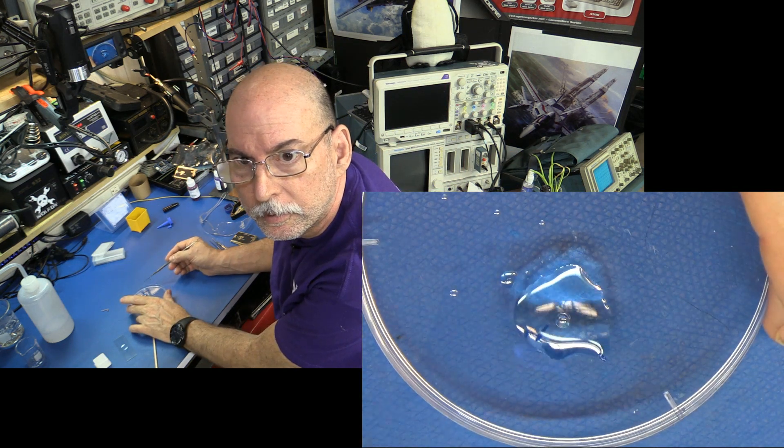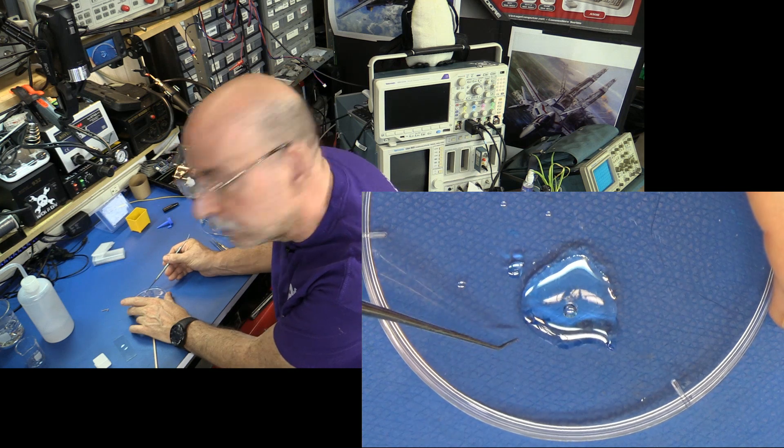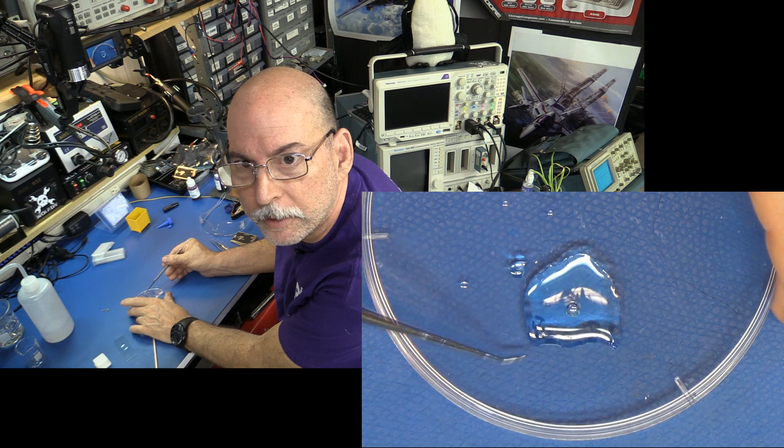You'll see inside this water the blue floaty things — those are our root tips and they're very blue. I might have screwed up but I have others. You can see this little piece of transparent glass I'm holding — that's a slip cover for a slide. I'm going to take this and crush the root tip with it, spreading it out on the slide. I remember breaking a lot of slip covers and possibly bleeding doing this, but this is how I remember doing it. So we're going to try and crush and smear it enough to see through to individual cells. Underneath here is a smashed root, and I've added water — capillary action drew the water back in. It's not a big bright blue glob, so maybe we can see something.